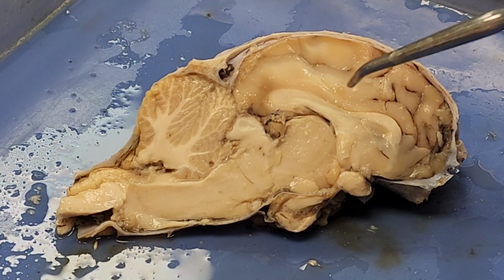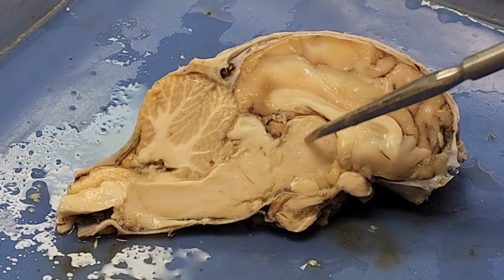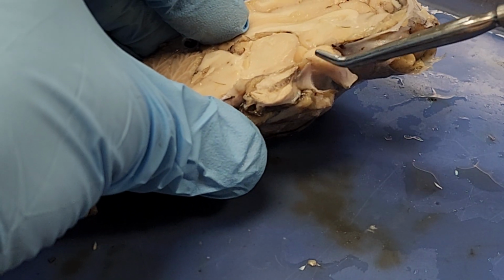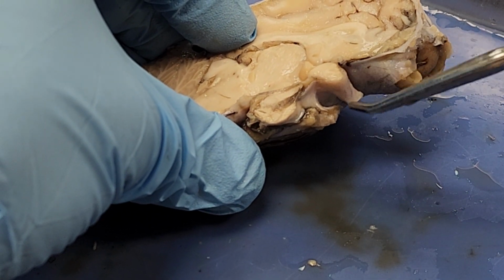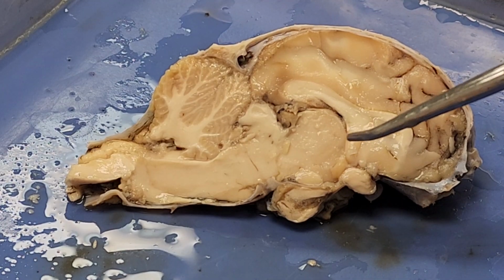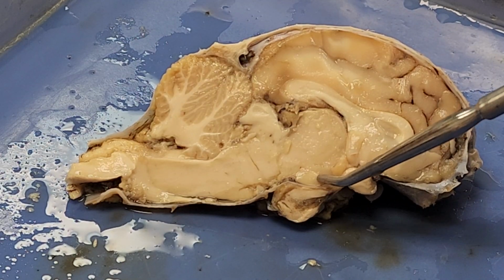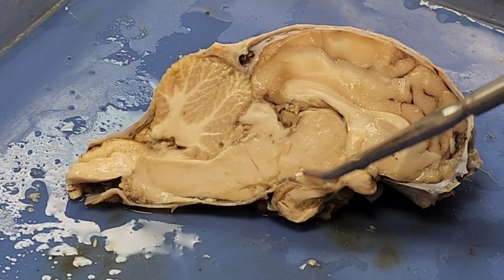All right, so underneath my hypothalamus, down here, I've got a couple of structures that I want to point out. This part here is part of my optic chiasm. Remember, chiasm means X, so you can see how this is starting that process to actually form the X. Then along the back, as I work my way posteriorly, you see this little lightly colored bulge right here. This is my mammillary body.